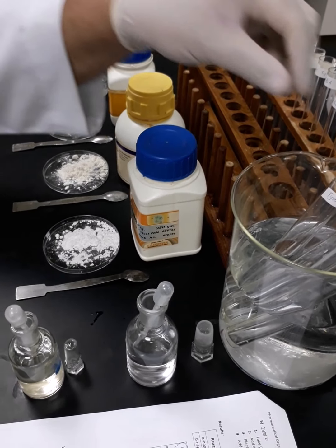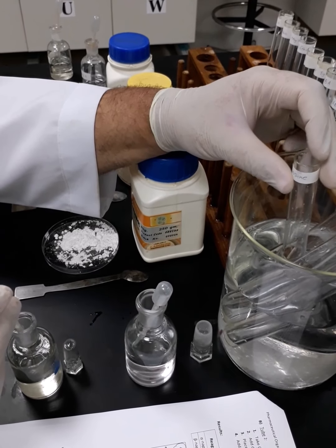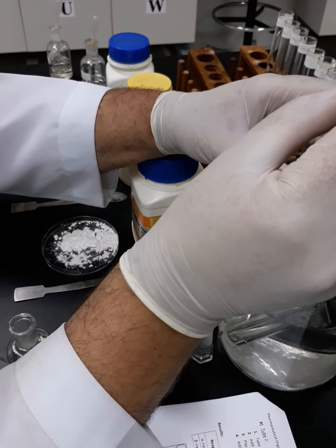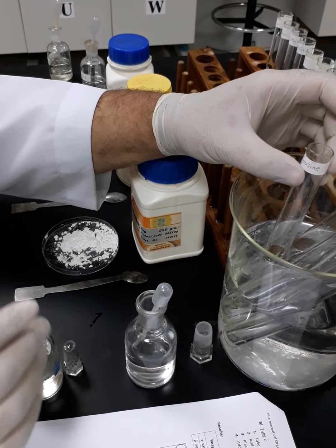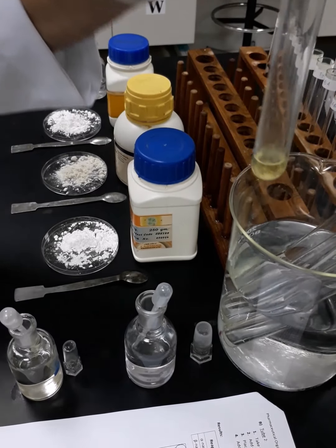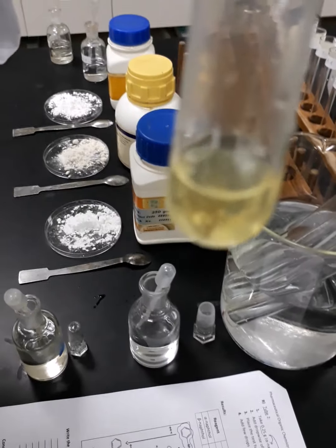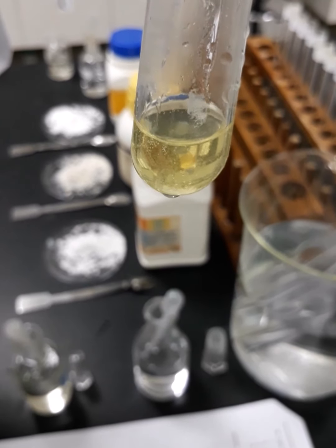Okay, now we are going to proceed. I will add sodium nitrite to the test tube containing tyrosine. 5 drops, 1, 2, 3, 4, 5. And yes, I can observe that there is bubbling. Okay, I'm going just to show it to you and return test tube quickly. I'm not sure if you can see it or not. It's very clear. Okay, can you see the bubbling from the bottom of the test tube? So we have immediate bubbling occurs with the tyrosine.